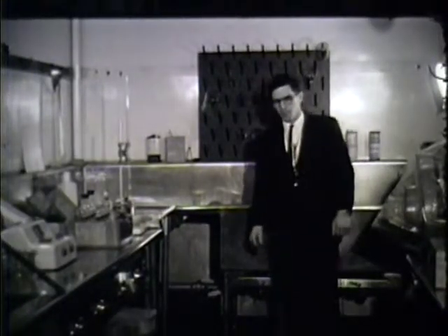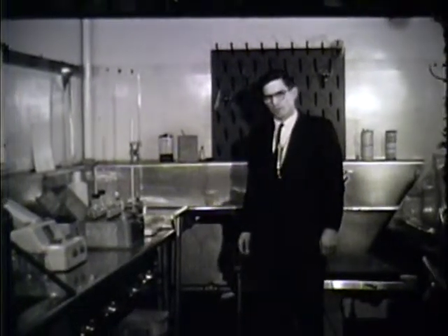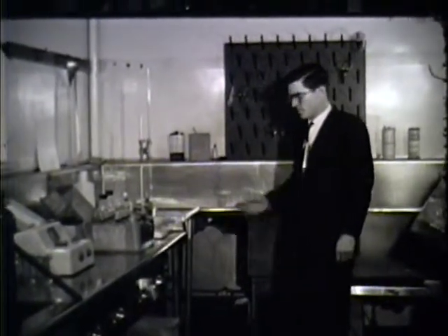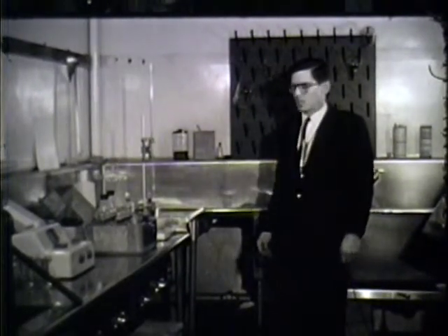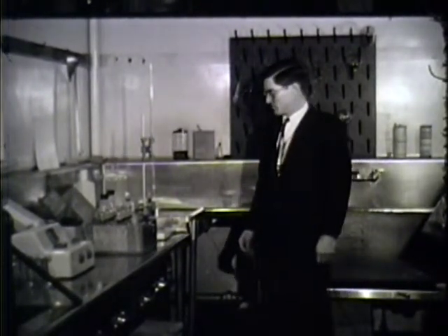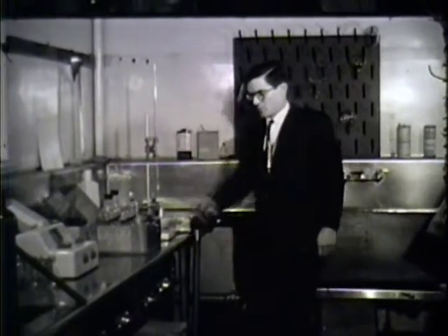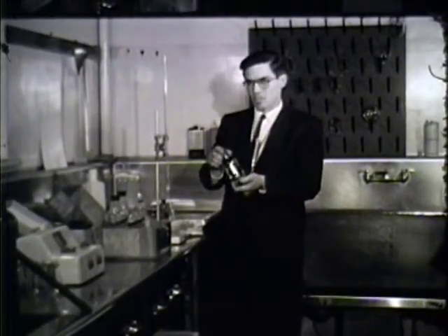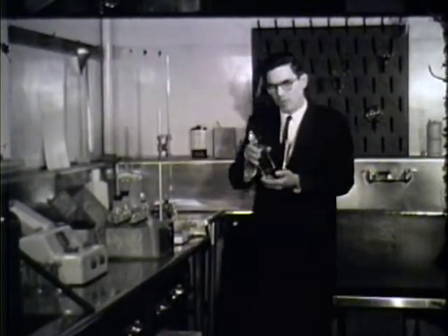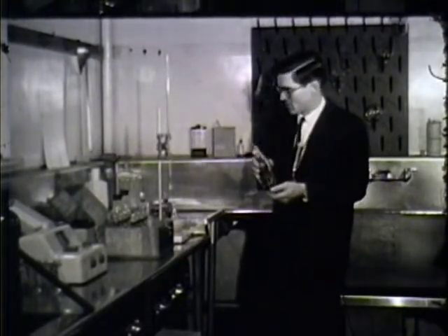After having completed our 4 to 6 hour run on Lake Whatcom, during which all the samples are taken, they are brought back here to the laboratory at the Institute for Freshwater Studies at Western Washington State College and are analyzed further. Here, for example, is the oxygen bottle that you saw being fixed in the field. This was the one that we shook so violently to fix the concentration of oxygen.